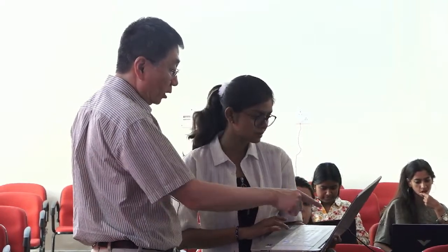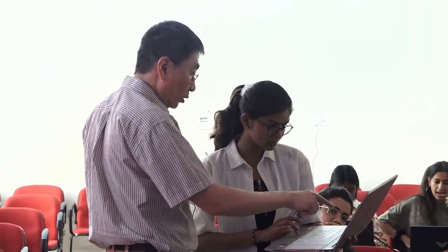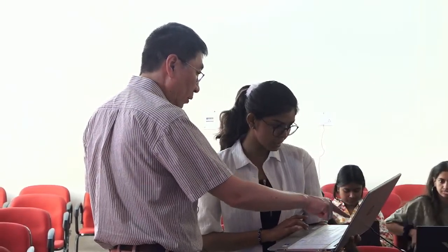Go over. You can center the valine. Click on the valine, you center there, and then you have to zoom in. You know how to control the trackpad to zoom in? The right mouse. Drag the right mouse. You know how to do that? Yes. Then you're good. After getting the sequence, what do we have to do? Click on the valine. You're centered there, and you look around. You see the extra residue. Rotate around it. See, this is the lysine right here.